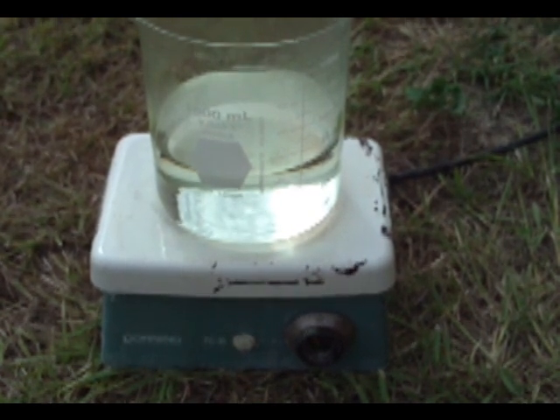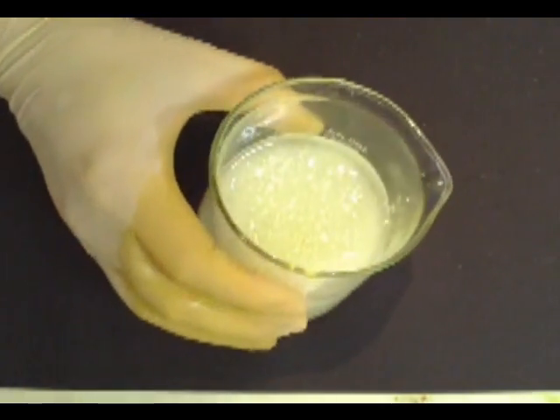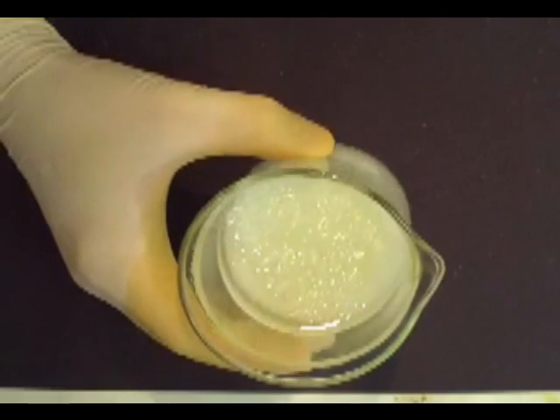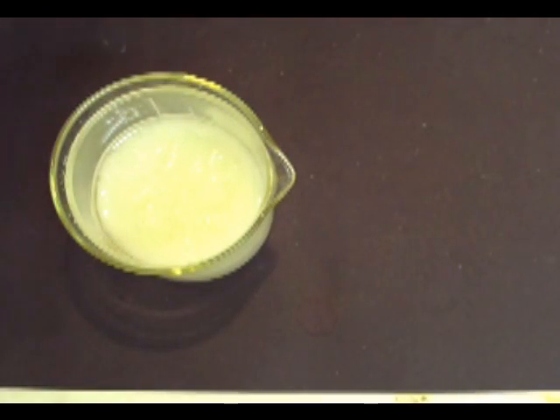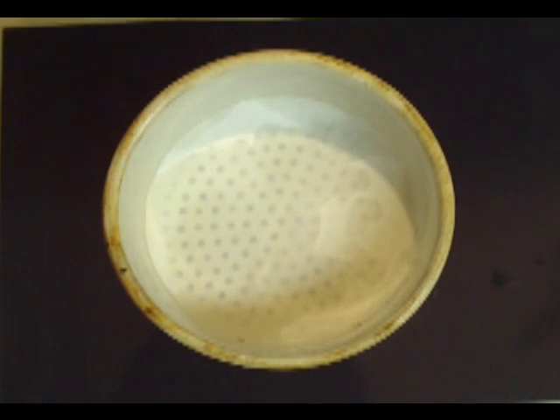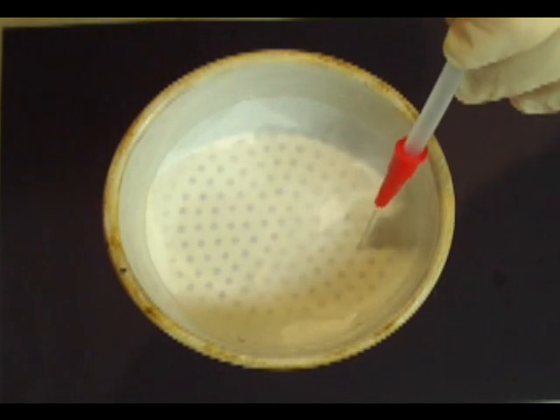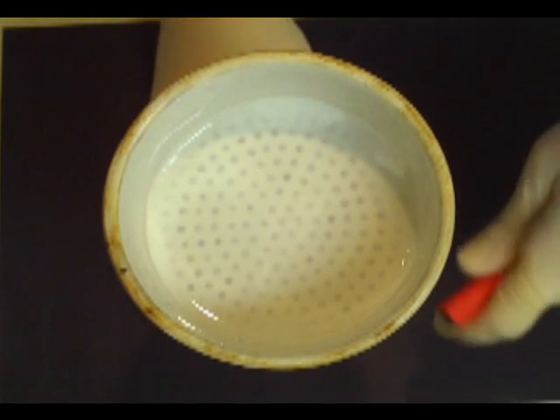When done you'll get this. I poured it into a smaller beaker to let it cool slowly and was rewarded with crystals of ammonium chloride. So now we need to set up for a filtration. I've already placed a filter in my filter flask, so we need to add some water and then go ahead and turn on our vacuum.